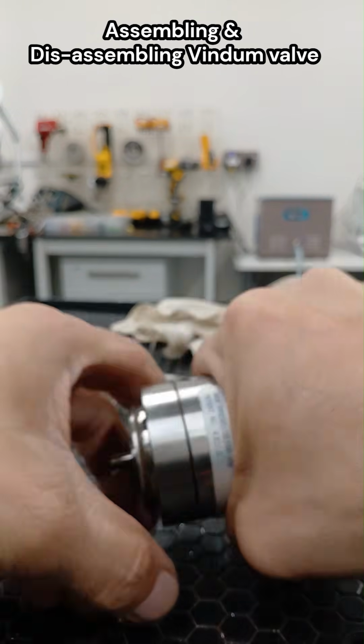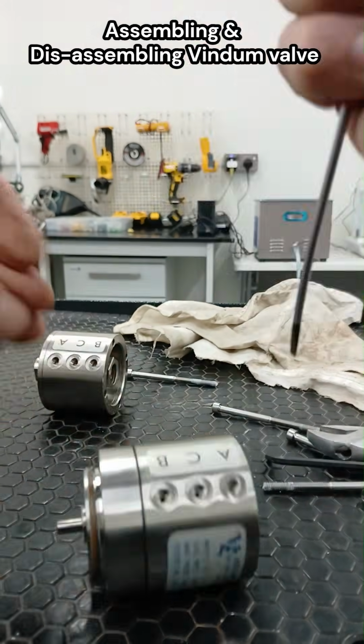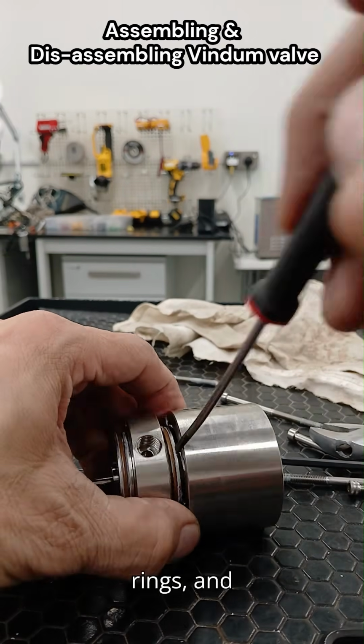Two, disassembly. Remove the actuator or handle, depending on manual or automated type. Unscrew retaining bolts or housing screws. Carefully lift out the rotor assembly, avoiding scratching the sealing faces. Remove old seals, O-rings, and gaskets.